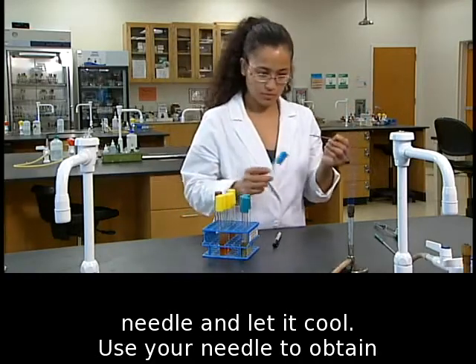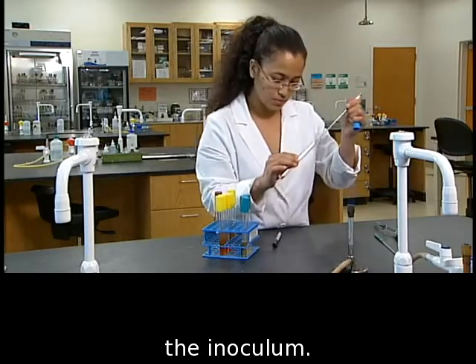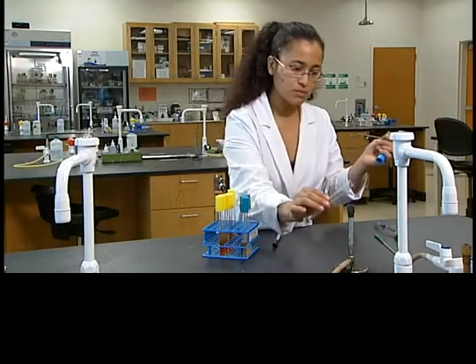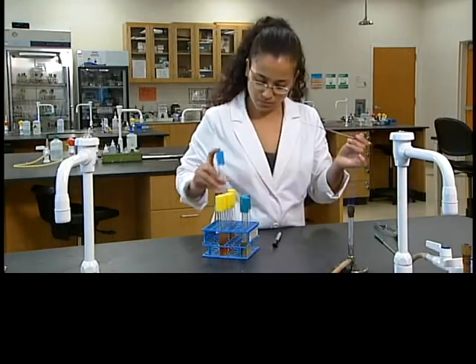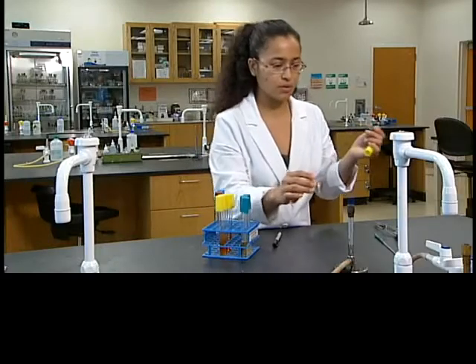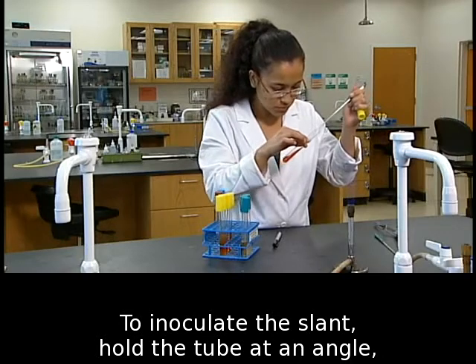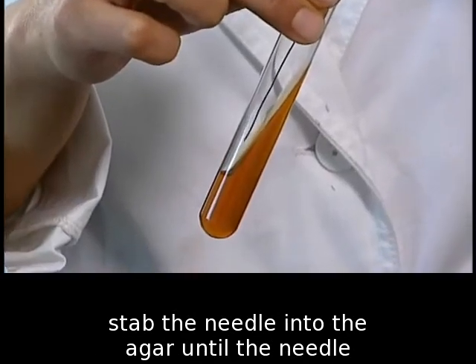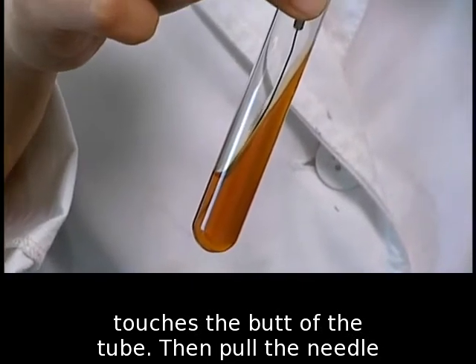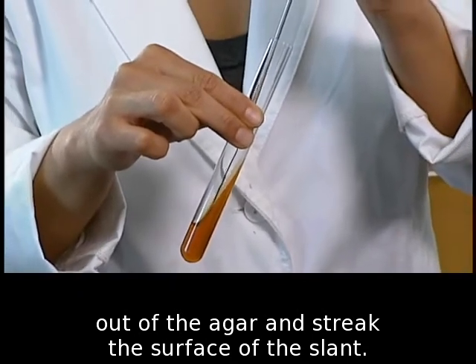Flame your needle and let it cool. Use your needle to obtain the inoculum. To inoculate the slant, hold the tube at an angle, stab the needle into the agar until the needle touches the butt of the tube. Then pull the needle out of the agar and streak the surface of the slant.